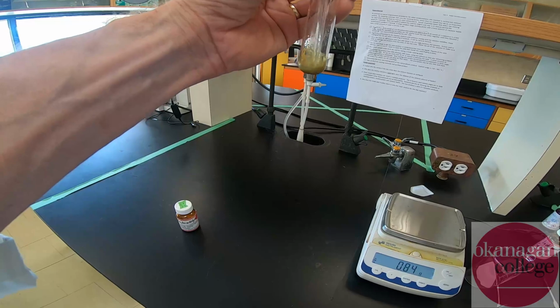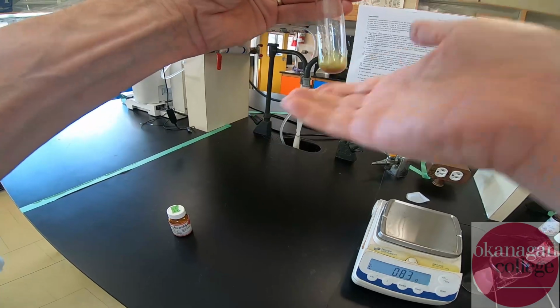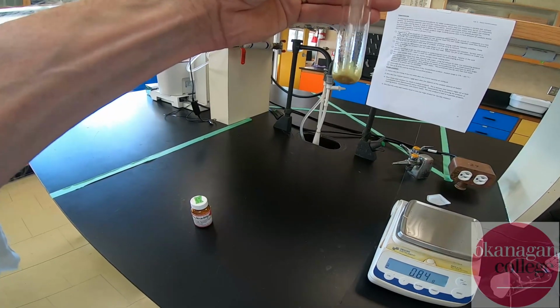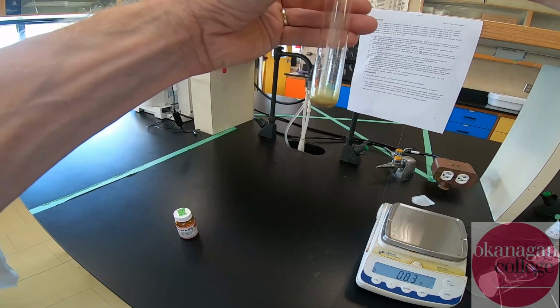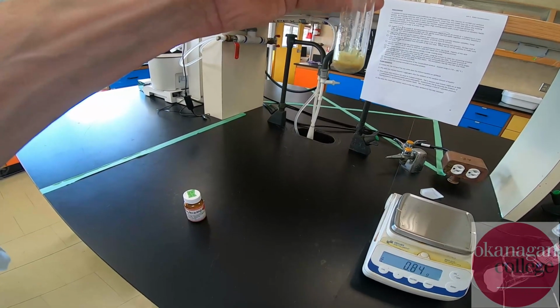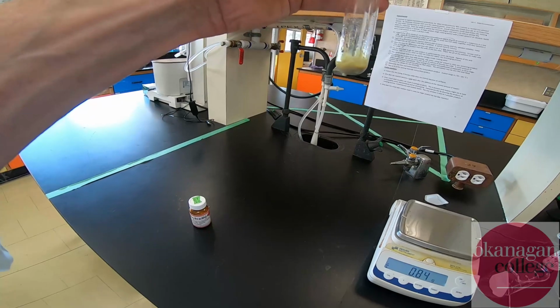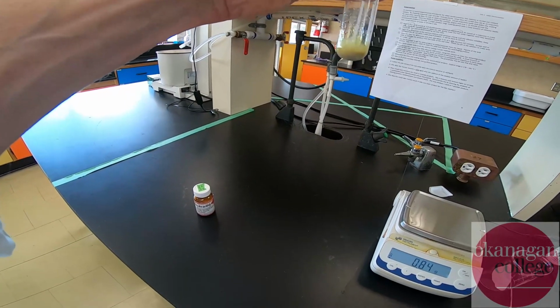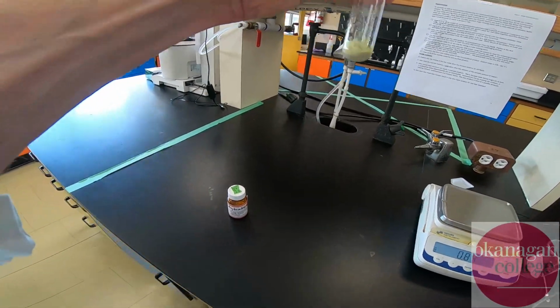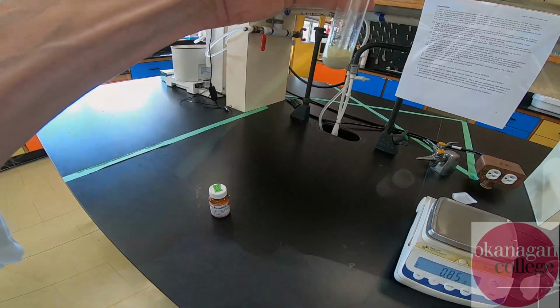Okay, so we've been mixing for about 3 or 4 minutes. You can see that the solution is starting to become murky. It is starting to warm to the touch, so the reaction has started to go. And again, the murkiness is really starting to develop now, and that is the production of the large molecule, the large final product. I am going to try to keep this moving as best I can, because if I don't, you get a very solid plug of material and it's very difficult to work with. I'm going to keep moving it so it's easy to transfer out.